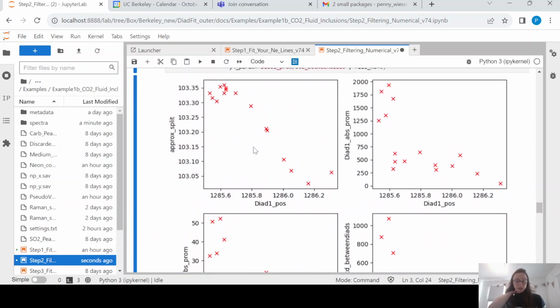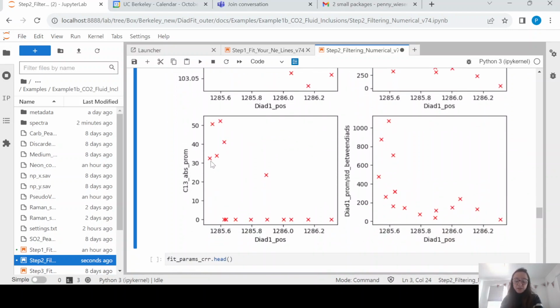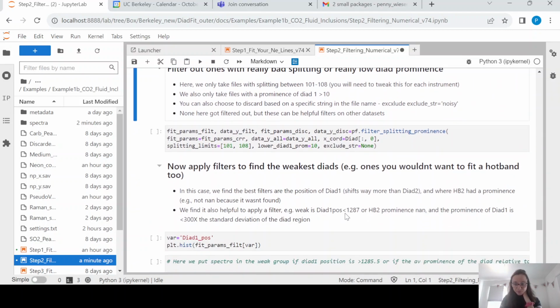So the key parameters which can be really helpful is the position of diad 1. This correlates really, really well with density, and we can see that actually, the approximate splitting and the approximate diad 1 position just from that SciPy find peaks algorithm, they're pretty similar in here. None of these are really, really strong. It's not like 2 or 1 variations on the x-axis. You can see that we found carbon-13 peaks in these spectra, and we didn't find them down here. So these are all different ways that you could subdivide the spectra. And you can see all of the columns here that you could use to filter with.